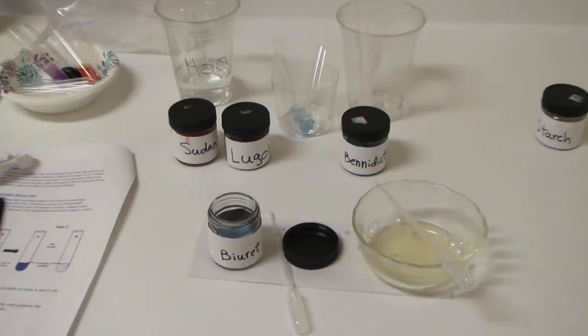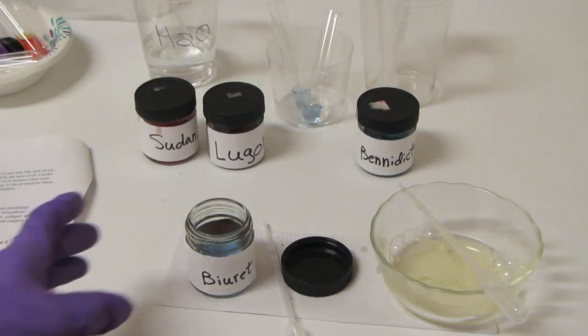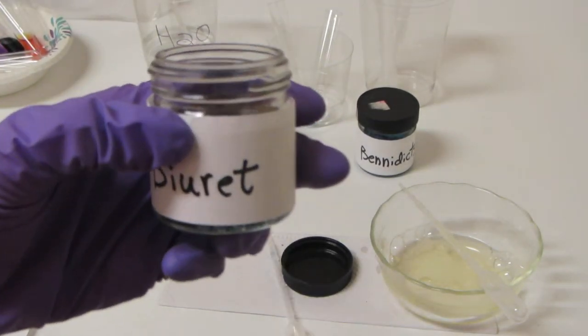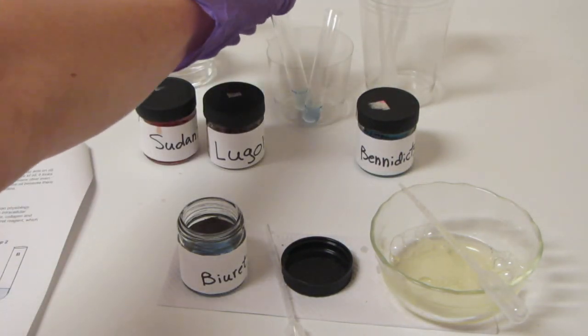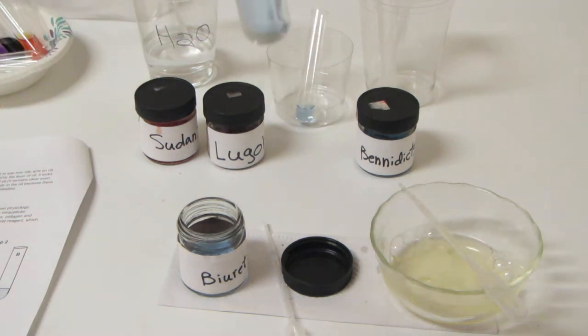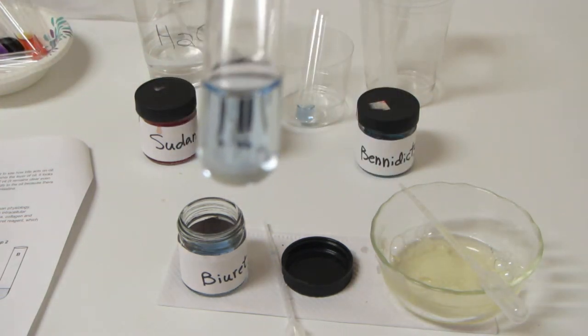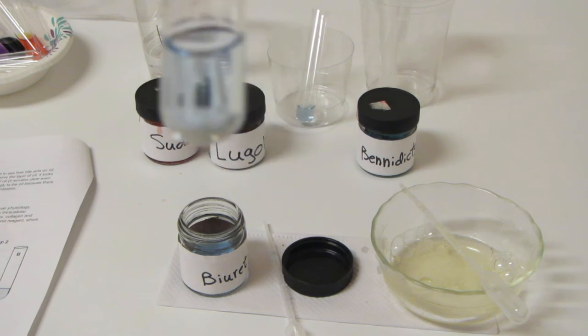But first let me just zoom in a little bit here. So here's our Biuret Solution, and if you remember, the Biuret Solution is this beautiful shade of light blue, almost a gray blue.